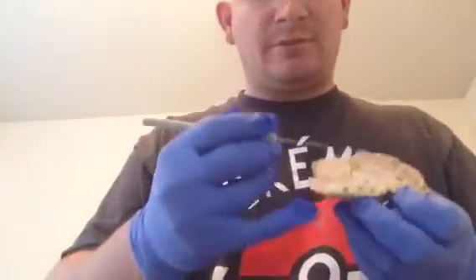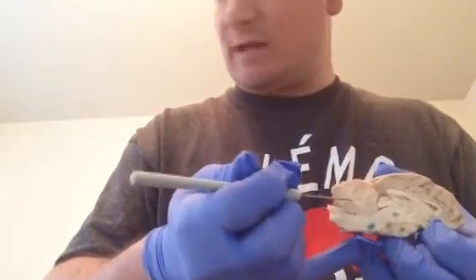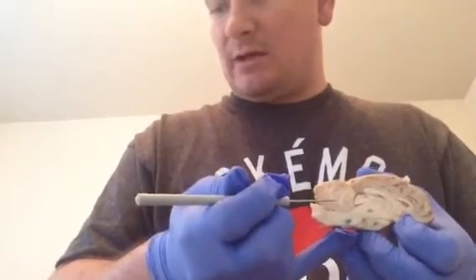The cerebellum is pretty easily distinguished here, and as you can see, you still have the white and gray matter there. That's very obvious. The vermis would be the section connecting the two hemispheres of the cerebellum, and then that creates your lateral hemispheres, both left and right.